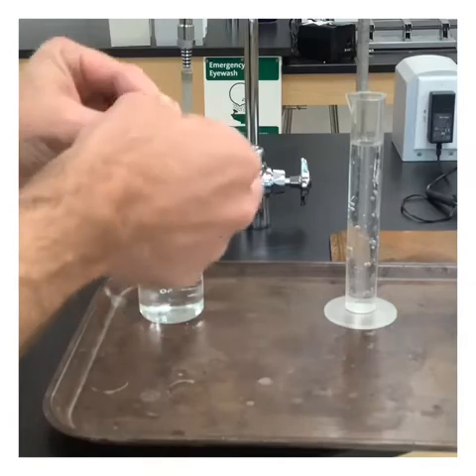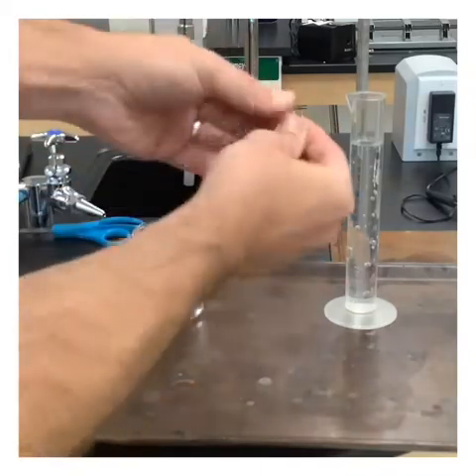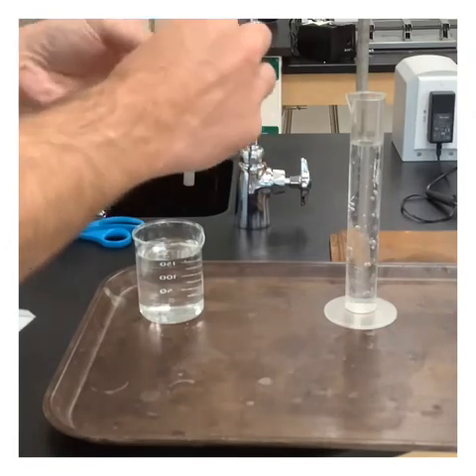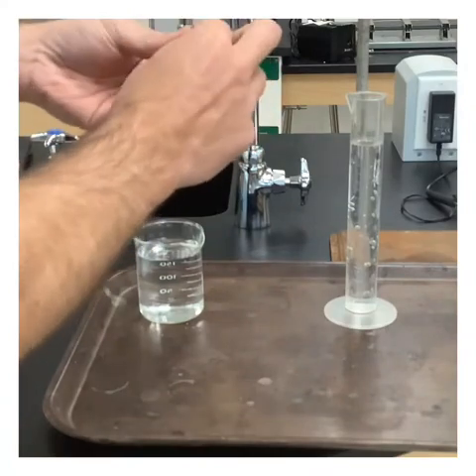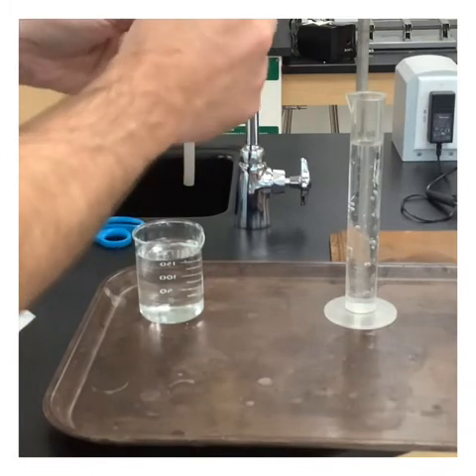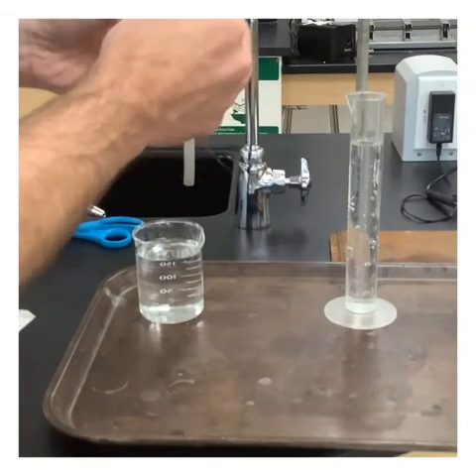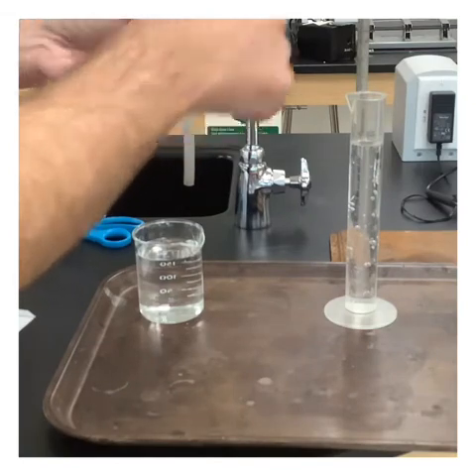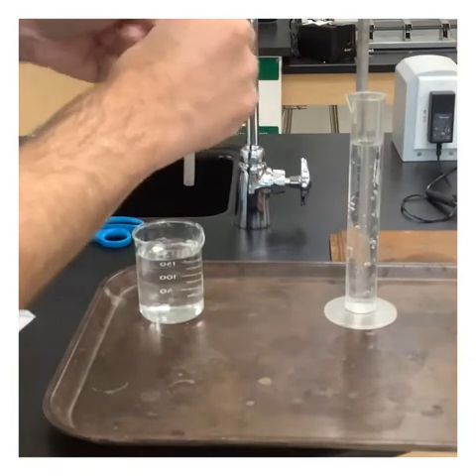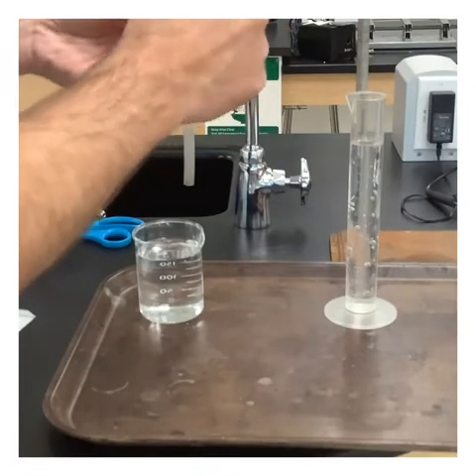So there's no science to this. We just start trying to kind of like roll it around in your fingers. And hopefully we start to get a cage that'll hold it. It's easier said than done, to be quite honest. There we go, we're starting to get it. Keep going. You can see I'm starting to get a nice little cage that'll hold it here. Closer and closer we come.